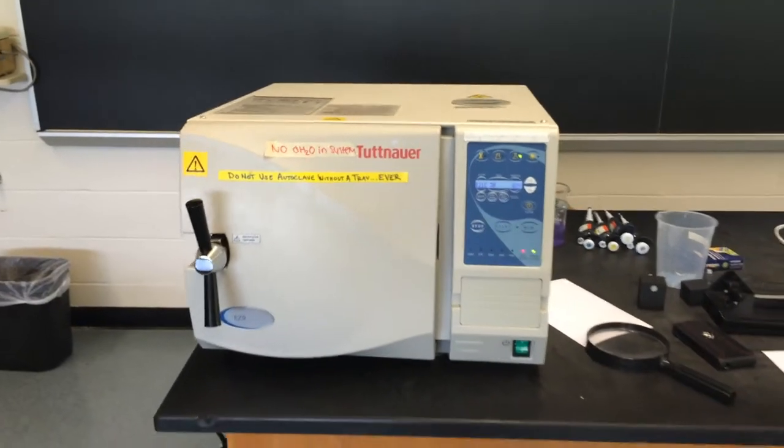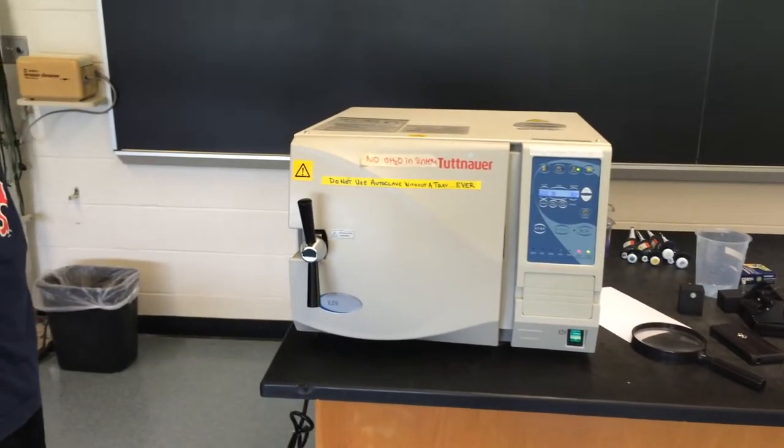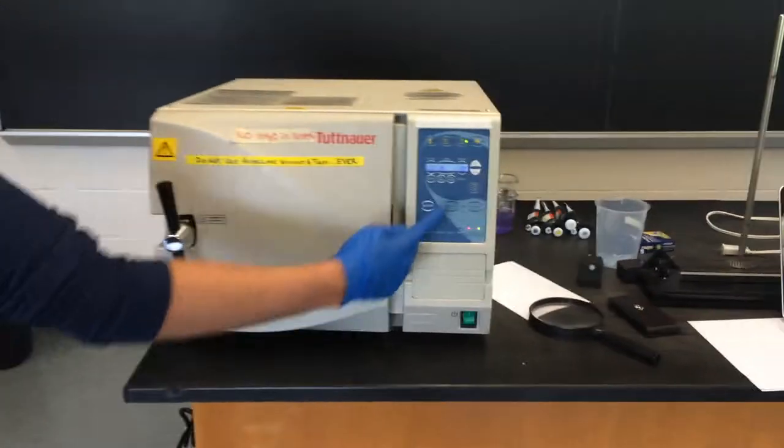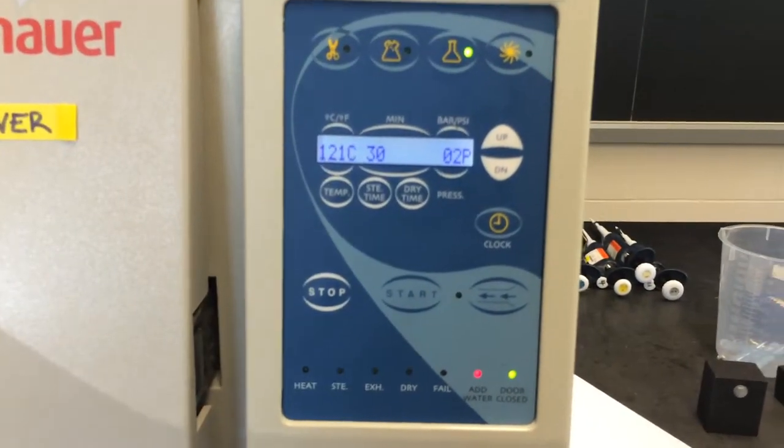After it's done, you want to wait until the internal temperature of the autoclave is about 50 degrees Celsius or so, because you don't want to burn yourself.